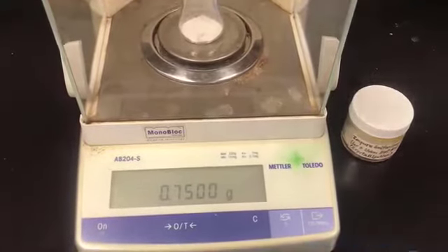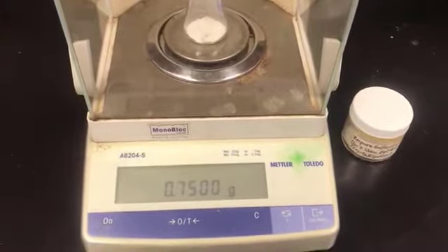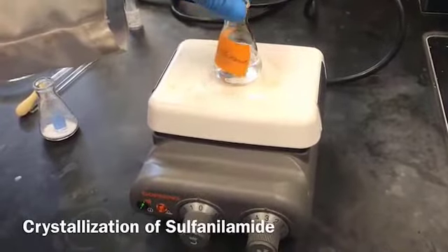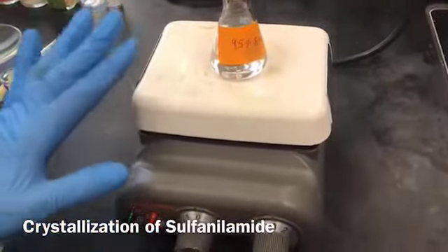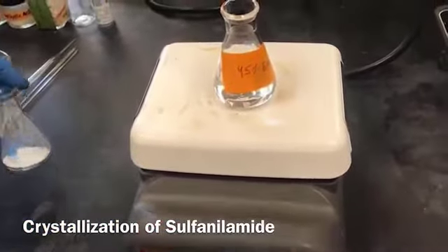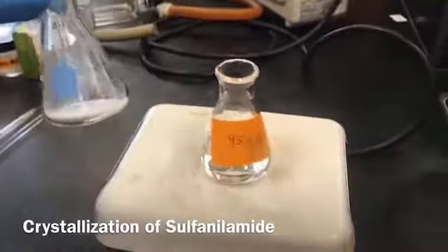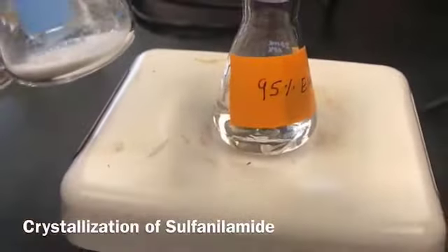I have already tared the Erlenmeyer flask before adding the sulfanilamide into it. As you can see here, this is the flask. It has about 15 milliliters of 95% ethanol. It's just warm right now, but I will let it boil. After it starts boiling, I'm going to add this boiling solvent into the sulfanilamide, which is already weighed, just to barely cover the crystals, as you can see.